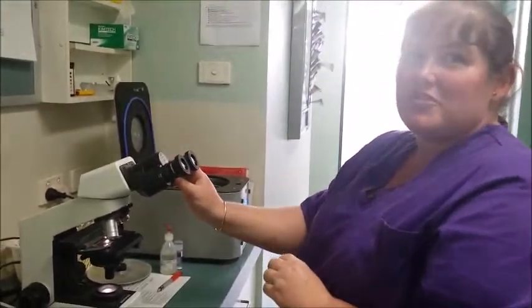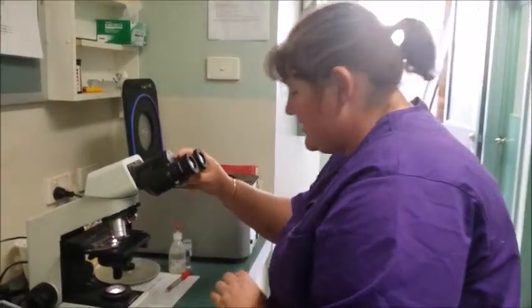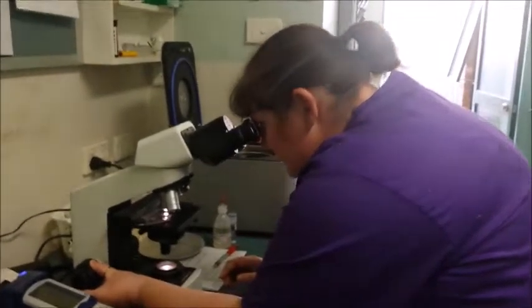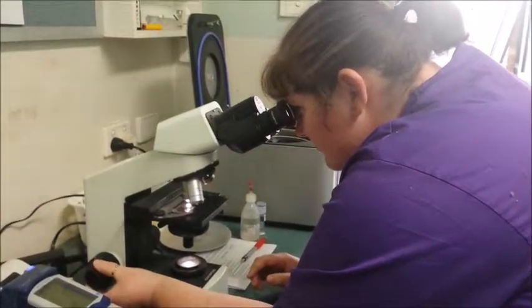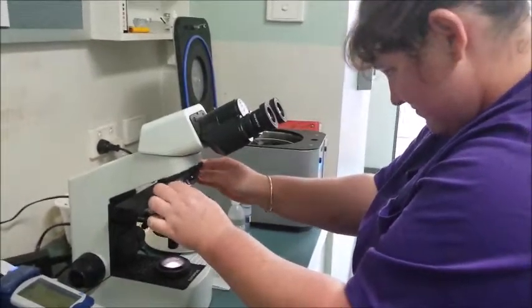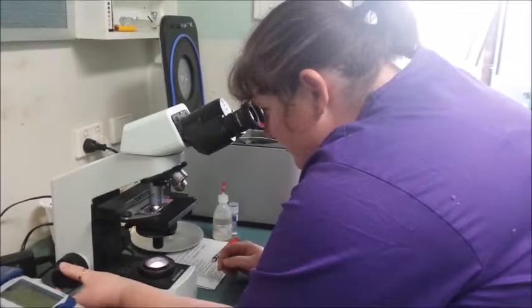In our clinic, we don't remove an eyepiece unless we're giving our microscope a deep clean. So at this point, use your coarse and your fine focus and adjust so you have a clear image. You can also go to a higher magnification and adjust using the fine focus.